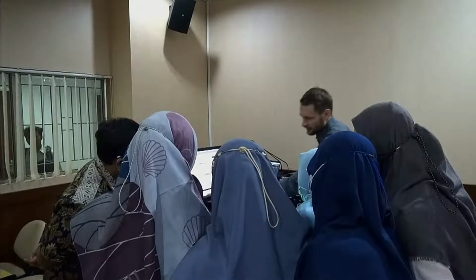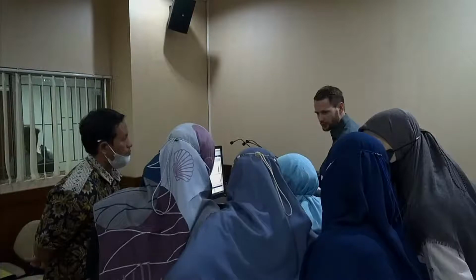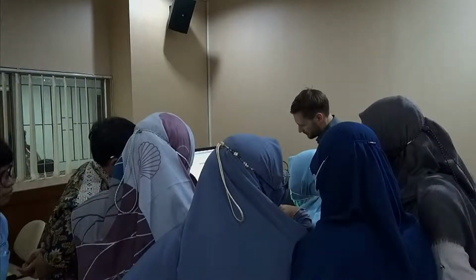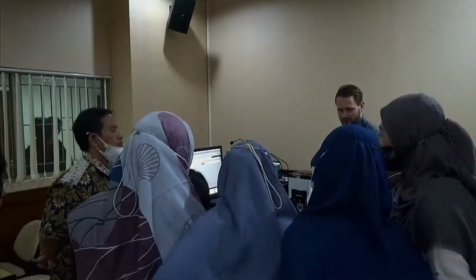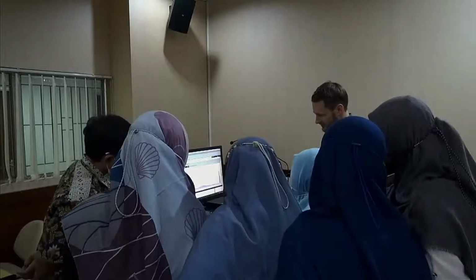There's a countdown, which is preset in the SOP. Sometimes if you need more dispersion time, you can increase the time, of course. If you add too much, you can click this dilute button, and fresh water will come in in order to lower the concentration, get back to a good level. And now we already started the first measurement.